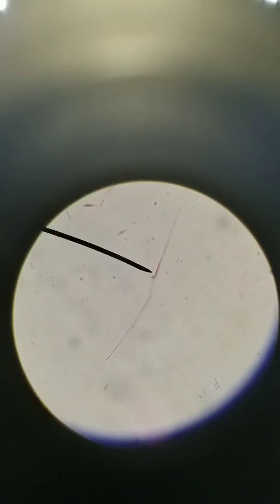And when this shortens, it pulls on things. The whole point of muscle is to pull in order to move things. So that's how its structure relates to its function. That's smooth muscle on its own, teased.